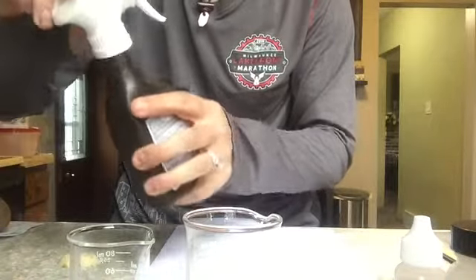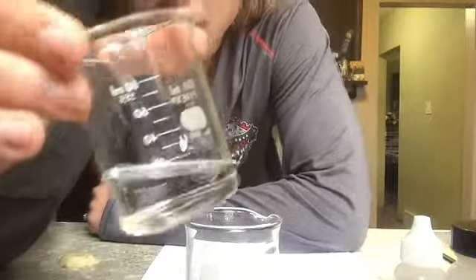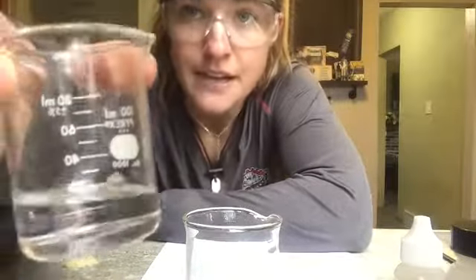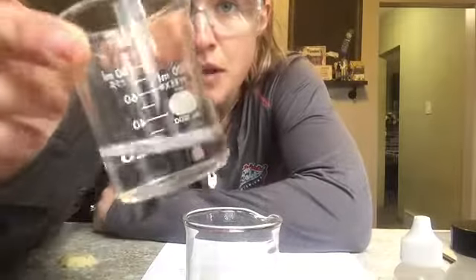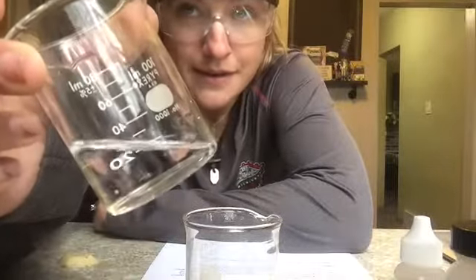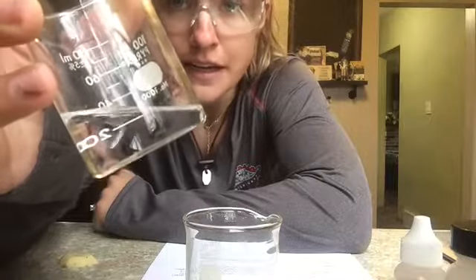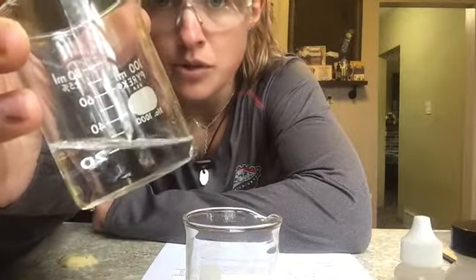Okay, so hydrogen peroxide naturally over time does a decomposition reaction. So this looks like water, and the formula for hydrogen peroxide is H2O2. So actually what happens is that extra oxygen will slowly come out of this, and if you leave it sit out long enough, it will turn into water, okay? However, this happens very, very slowly.